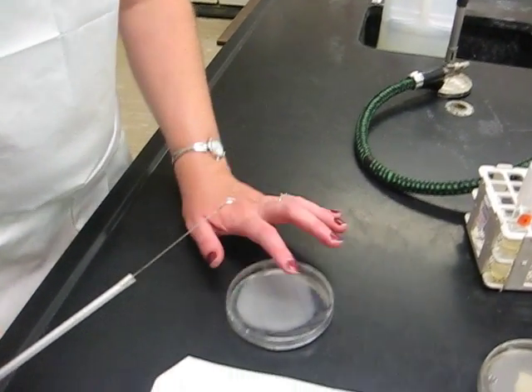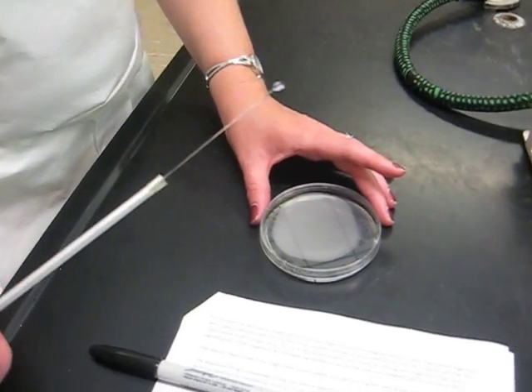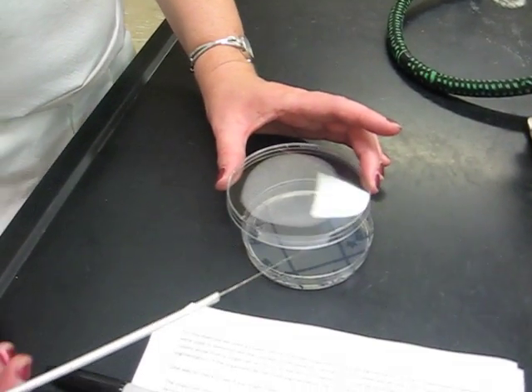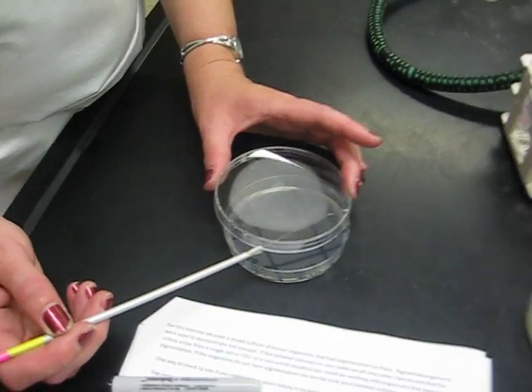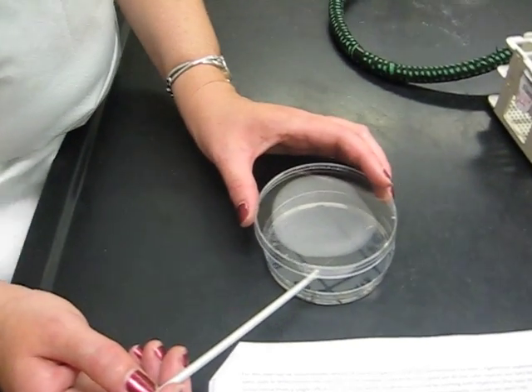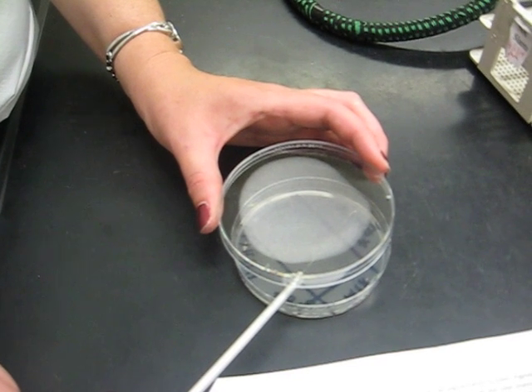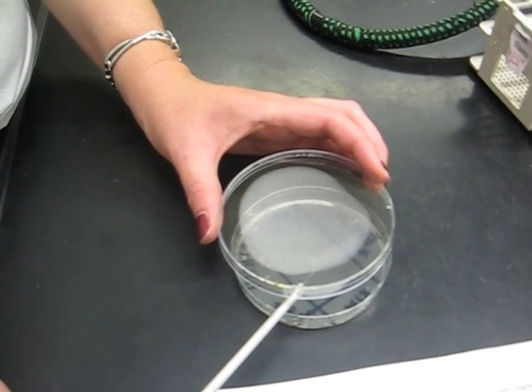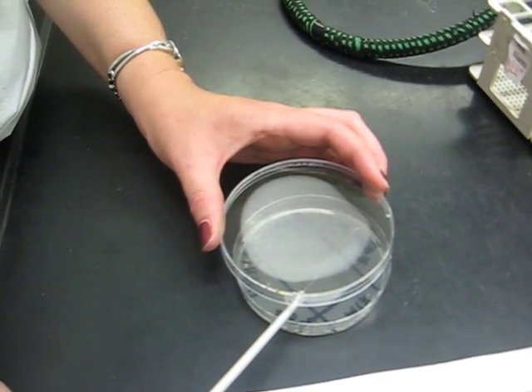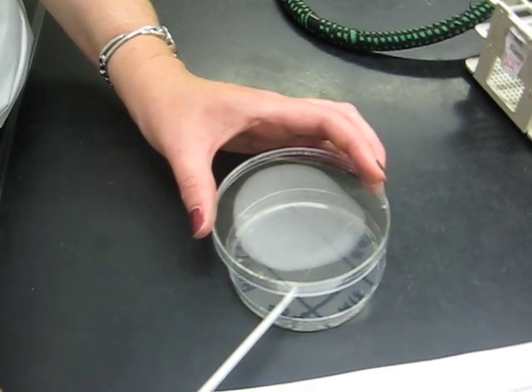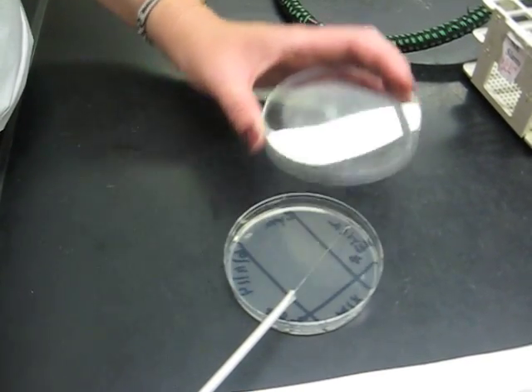Go to my plate. This plate, you can see through the lid. You would pick the lid up and go into that area. But for video purposes, so you can see my coloring, I'm going to remove the lid, which you would not do because now bacteria from me talking and from the air is going to fall onto this plate. It's probably going to get contaminated. I'm going to move it away.